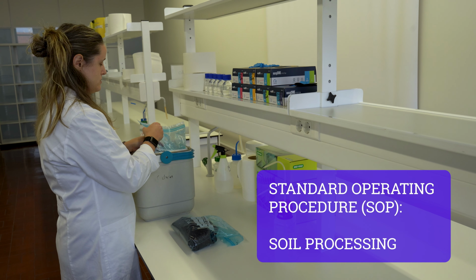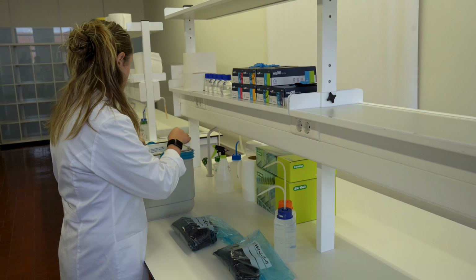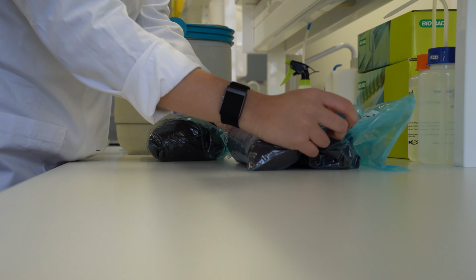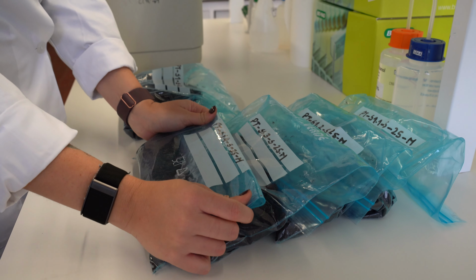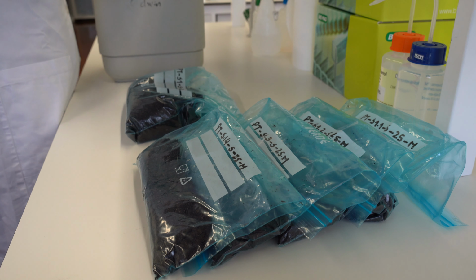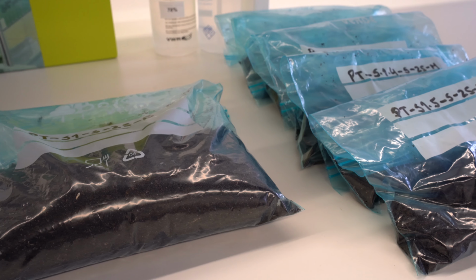This video demonstrates the standard procedure for processing soil samples for microbiome analysis, as well as for bulk soil intended for physical-chemical analysis. It also provides instructions on how to assess soil moisture, determine soil pH, and quantify particle size fractions.